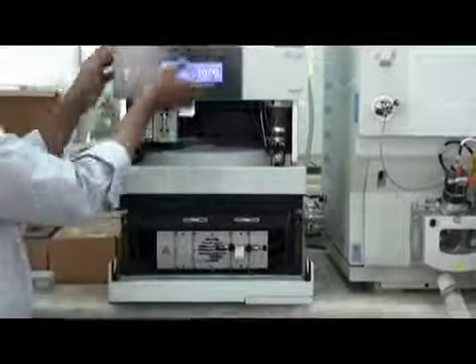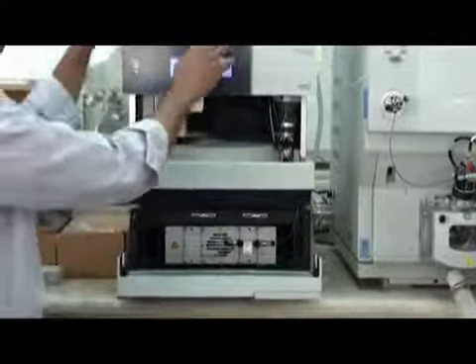But not for this one, not for this one. This is direct. No lock. You push it, no lock. Okay?